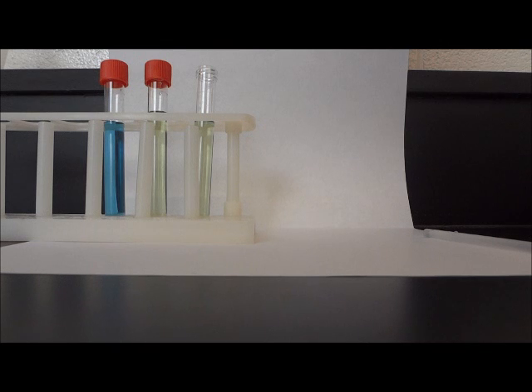In the remaining test tube, I need to add a sprig of Elodea. Elodea is a common exotic aquarium plant that has also escaped into some local waterways. Elodea is an excellent plant for our studies of photosynthesis because it is easy to grow and readily available. Recall from earlier discussions and studies that photosynthesis requires certain raw materials and produces certain products, one of which is released by the stoma as a gas.